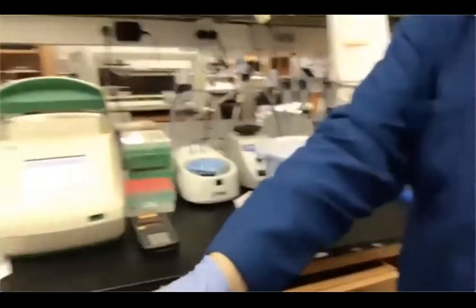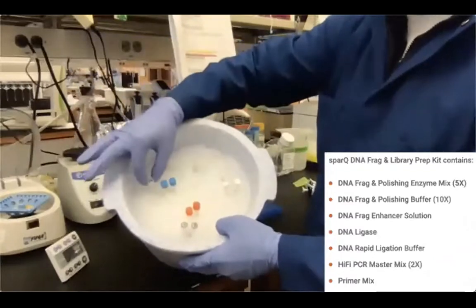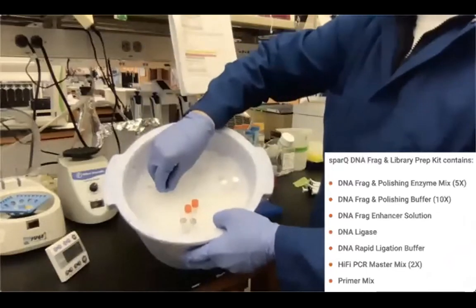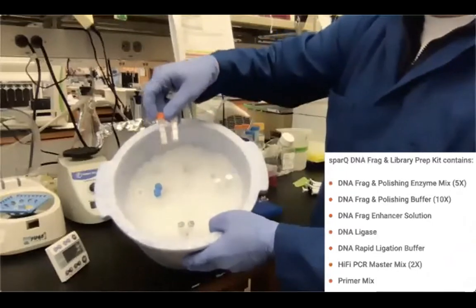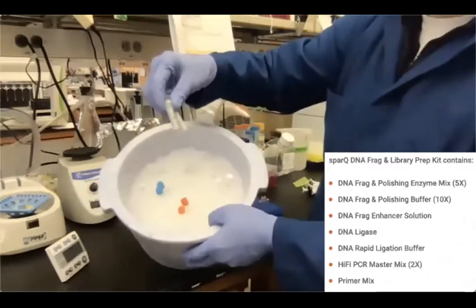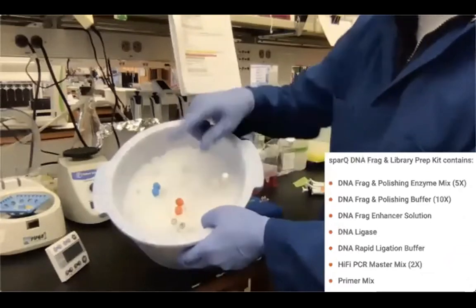Okay, so I have everything with me. I have my pipettes, my thermocycler already set for the first step, and I have all my reagents. So input DNA, lambda phage DNA. I have my enzymes and buffer for the first step, which is fragmentation and polishing at the same time. I have my reagents for the ligation step, so T4 DNA ligase and the ligase buffer, and also two different adapters. These adapters are 15 micromolar each, and we're going to tag each library differently.